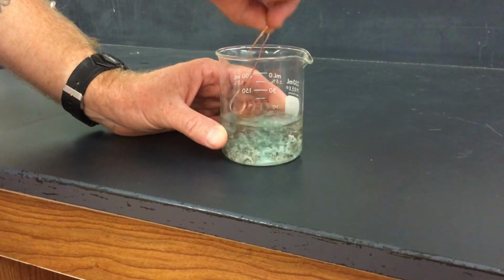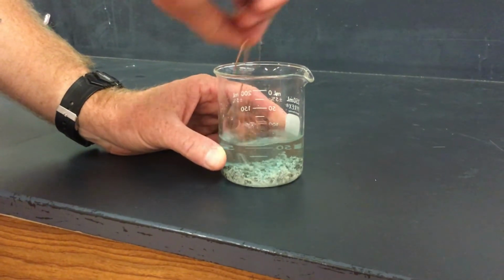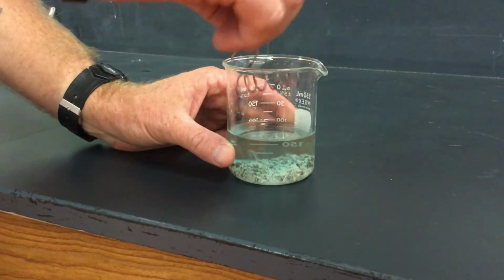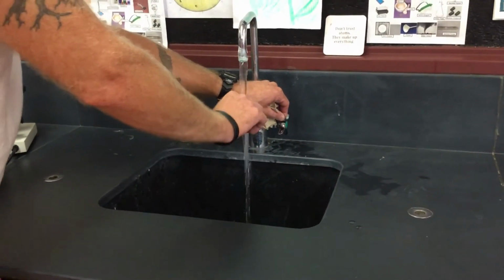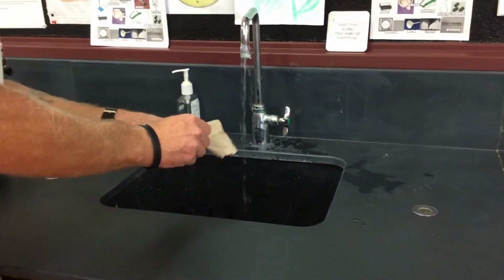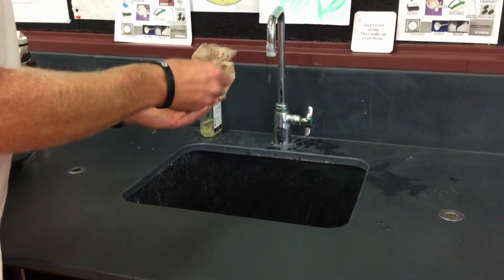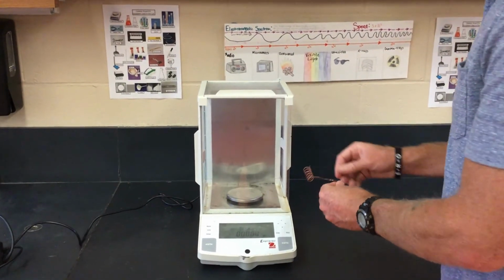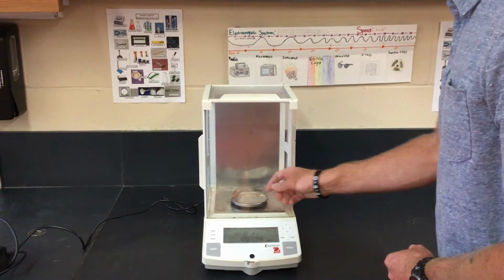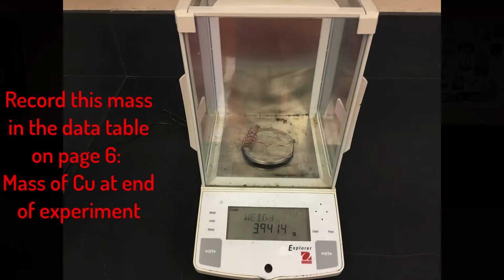Shake the crystals off the copper wire. Then take the coil out of the solution and rinse it with some tap water. Shake off the excess water, dry the copper coil with a paper towel, and make sure all the gunk is off the wire. Mass the wire on the electronic balance that reads to the 10,000ths place. Record this mass in the data table on the top of page 6.